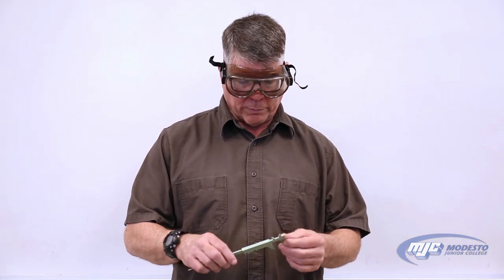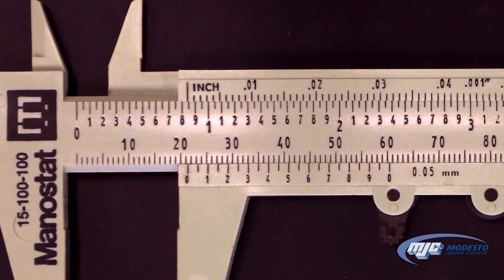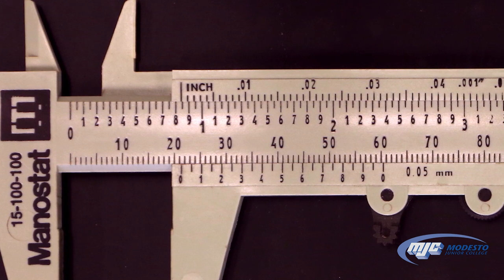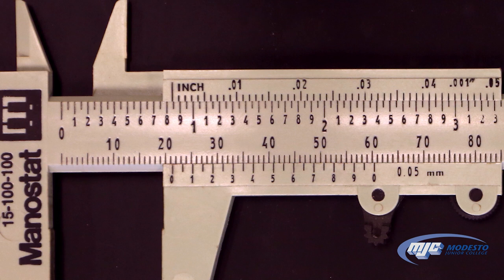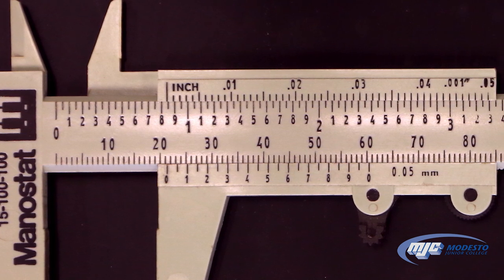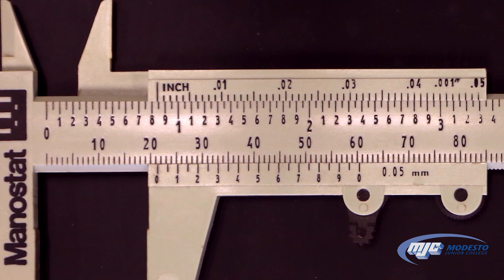This is how to use the calipers to measure the cylinder. There are two scales: on the top is the inch scale, and on the bottom is the millimeter scale, but we're going to read it in centimeters. We use the bottom scale, reading it in centimeters. The numbers 10, 20, 30 correspond to 1, 2, 3 centimeters, since 10 millimeters is one centimeter. Each of the small marks is a tenth of a centimeter apart — so 1.1, 1.2, and so on.